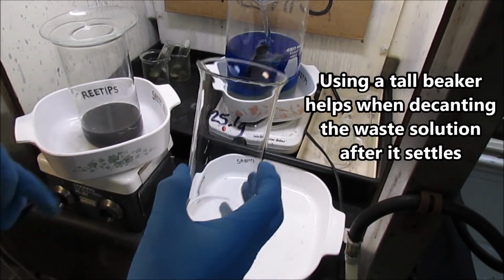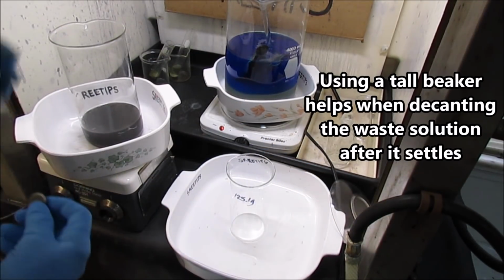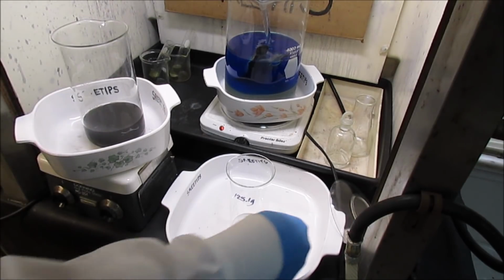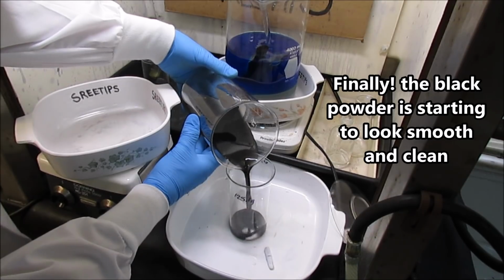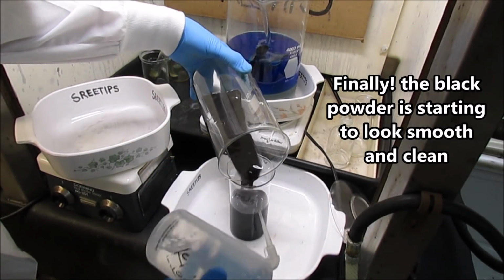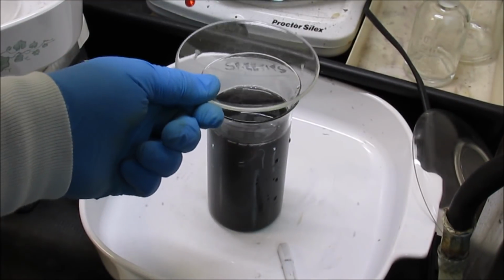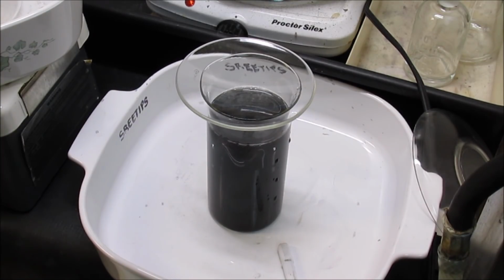I've got a tall 600 ml beaker here. Got the weight written on the side. I'm going to transfer the solution out of this beaker into this so it can settle and I can get the solution out of there easier. First, I want to get the stir bar out. Cover on here now. We'll let this settle and then I'll get the solution off the black mixed PGM powders.